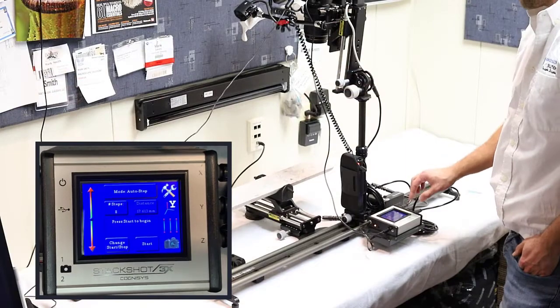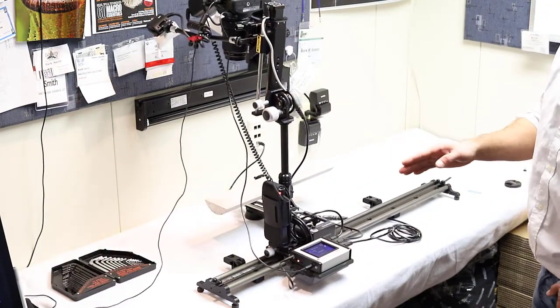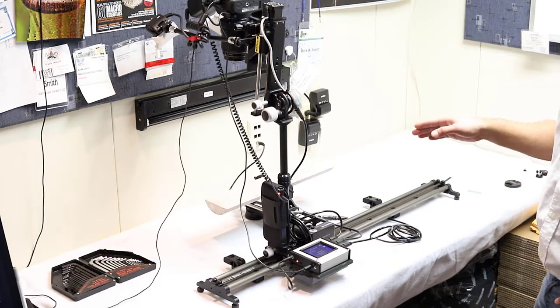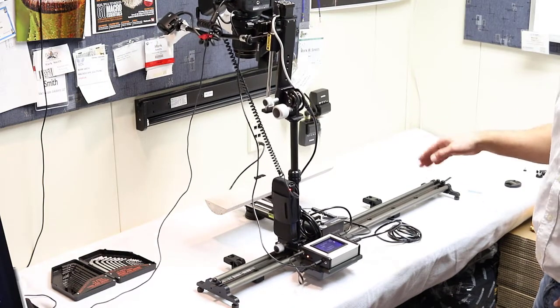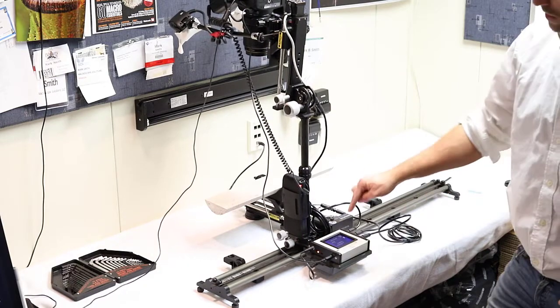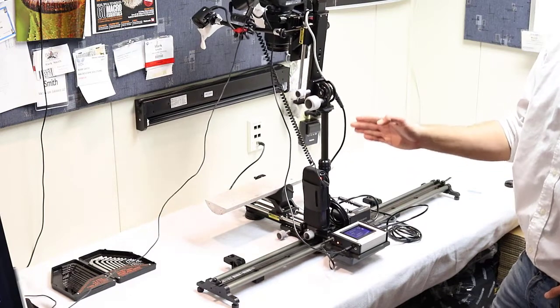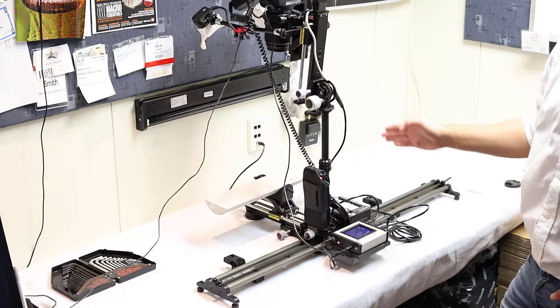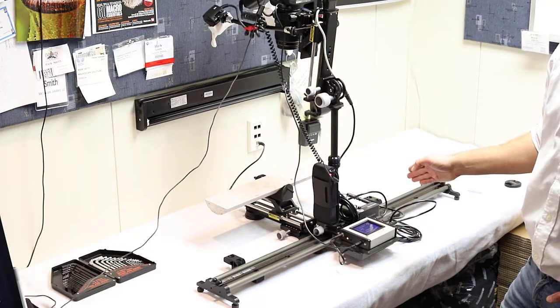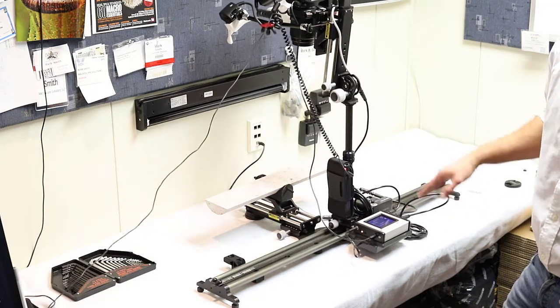So we're going to come back to our camera, we're going to press Start, and now what it's going to do is automatically capture 8 photographs through this material. Actually, I shouldn't say 8 photographs. One thing that's important to remember is that this controller is the number of steps. So it's actually going to do photo, step, photo, step, photo, step. Because it's going to step 8 times, it's actually going to capture 9 individual photographs.